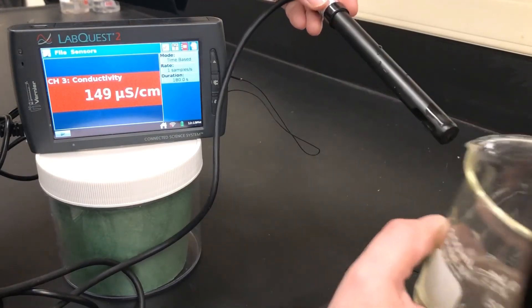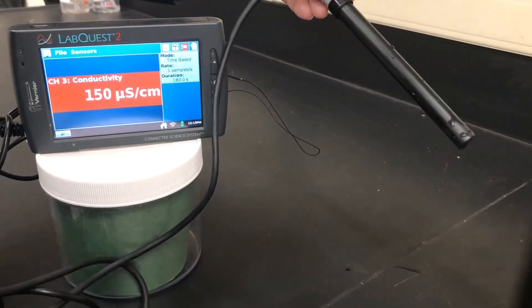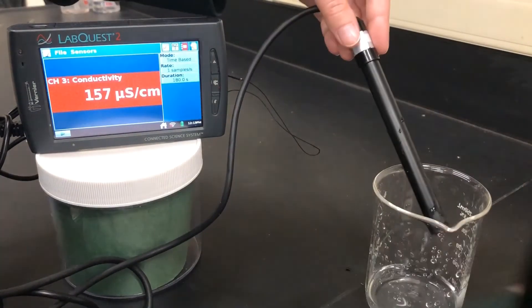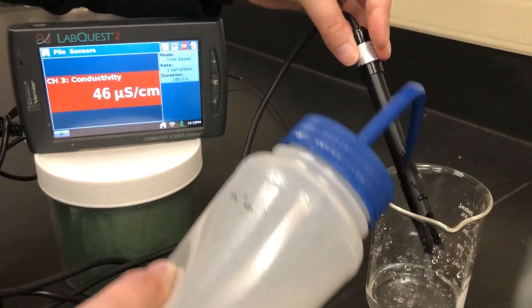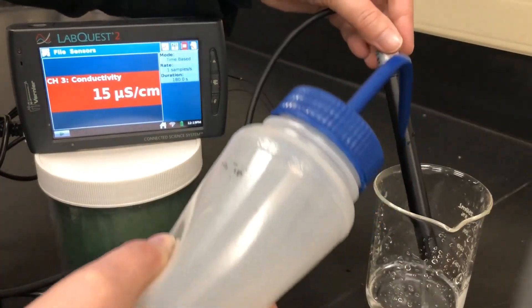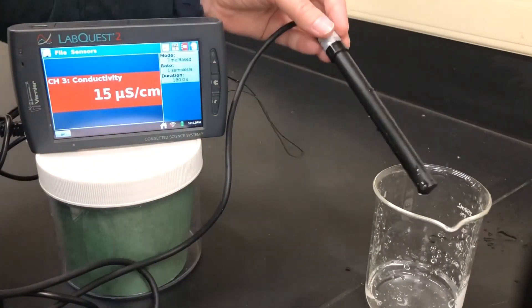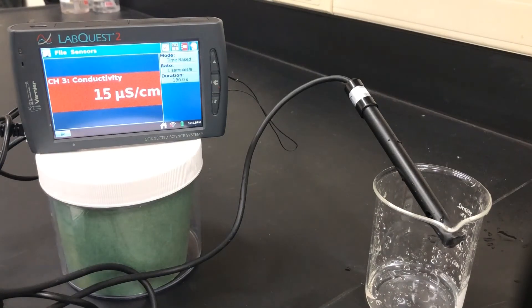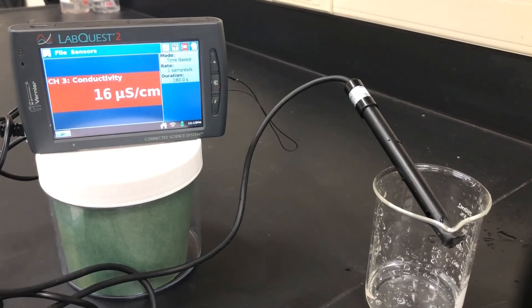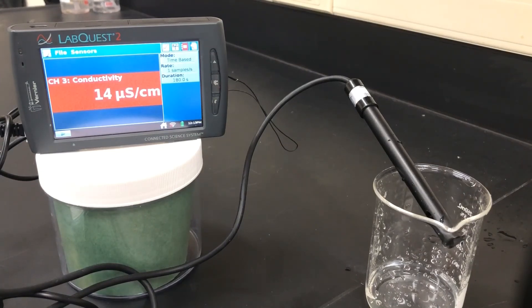We've now collected all of our data. Rinse your conductivity probe before you clean it up and put it away. From here we can compare how sodium chloride, zinc chloride, and iron 3 chloride differ — both in how concentration in drops affects conductivity for each solution, and how the three ionic compounds compare to each other in terms of conductivity.